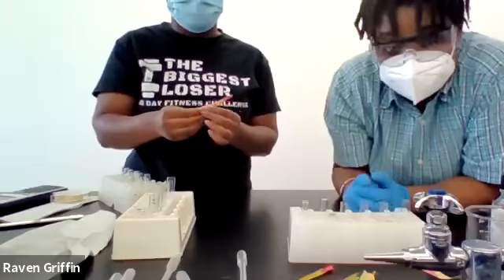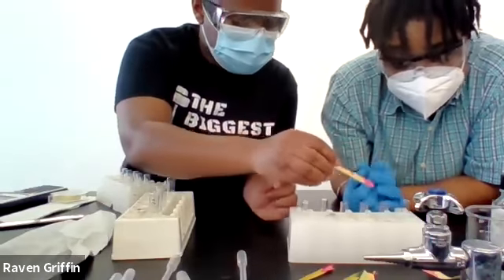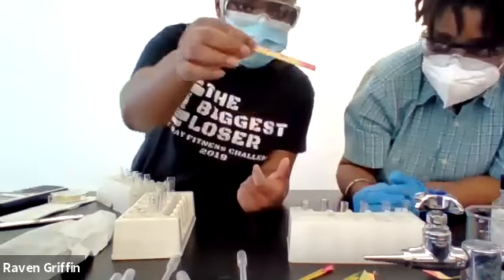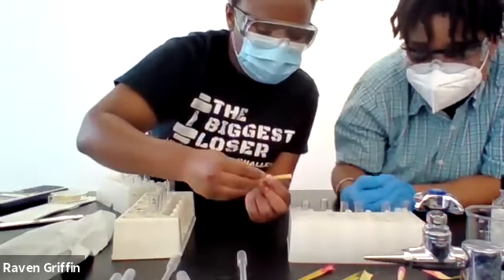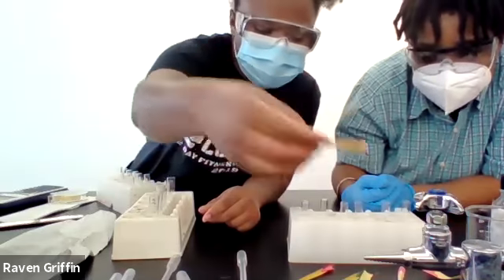This is just the initial part, that part A, am I right? Yes. Okay, go ahead. Going through everything again. So part A, HCl turned red, nitric acid turned pinkish, ammonium chloride turned yellowish orange or light orange.